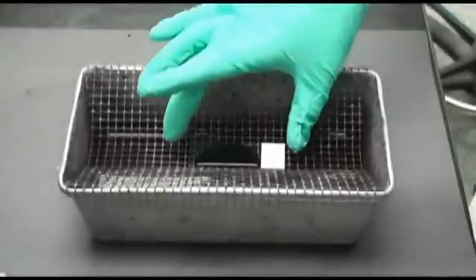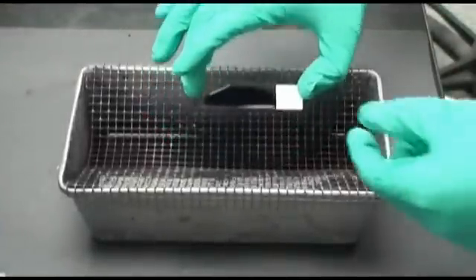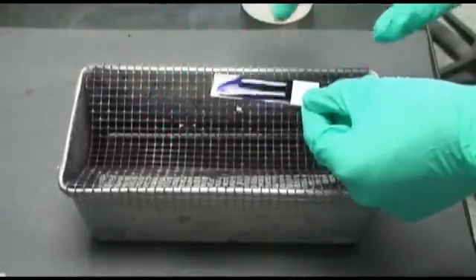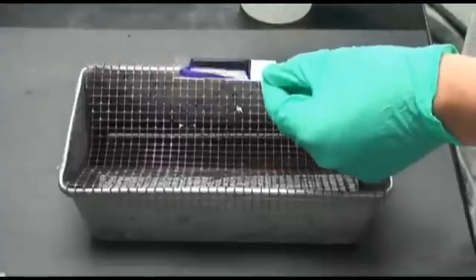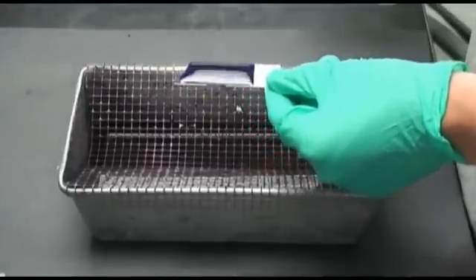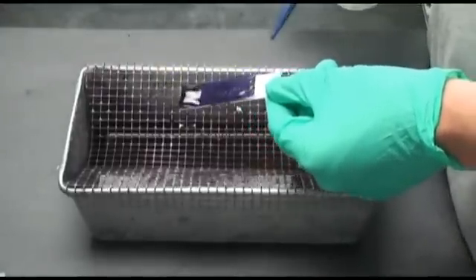Between each stain, the slide is to be rinsed with water. A gentle stream of water should be applied to the tilted slide, taking care not to spray directly onto the bacteria, as this may wash away the bacteria.